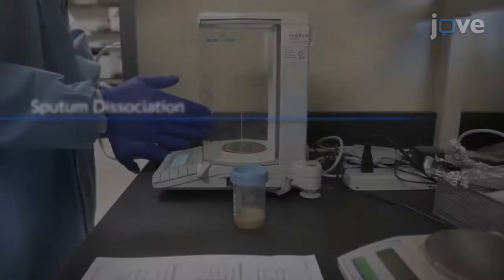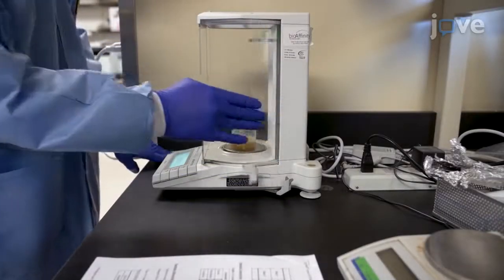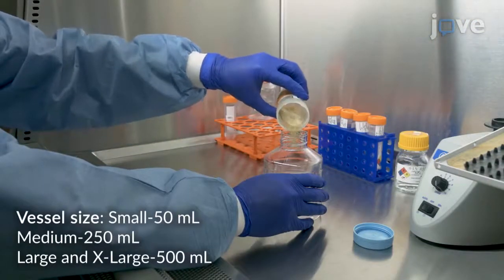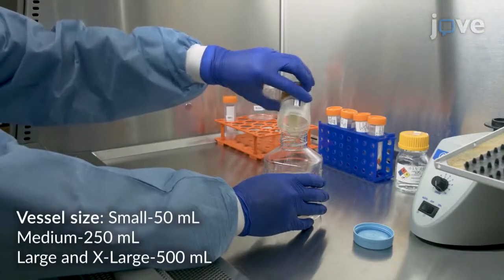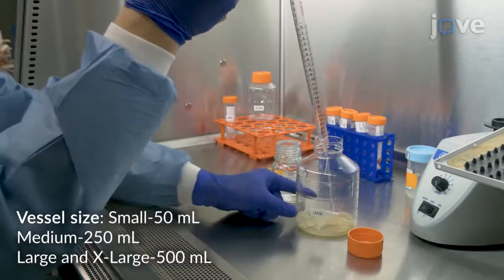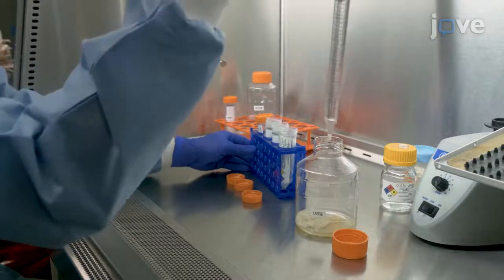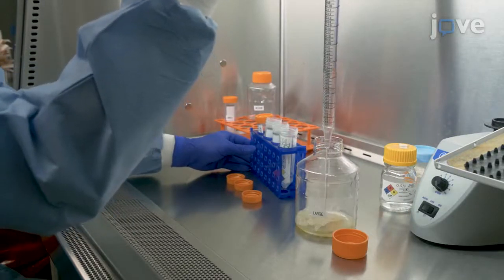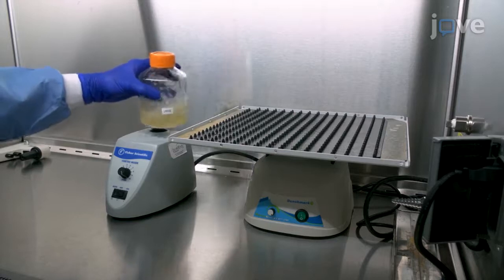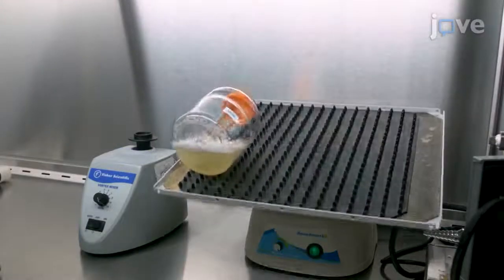To begin with, weigh the sputum sample to determine the volumes of dissociation reagents. Transfer the sample to the appropriately sized vessel based on the sputum weight. Then add 1 milliliter per gram of 0.5% NAC and 4 milliliters per gram of 0.1% DTT. Vortex the samples at maximum speed for 15 seconds and rock at maximum speed for 15 minutes at room temperature.